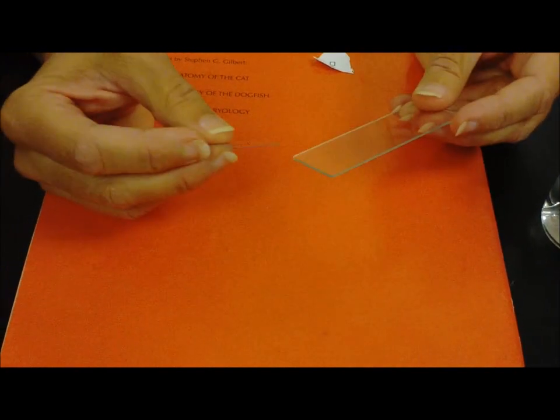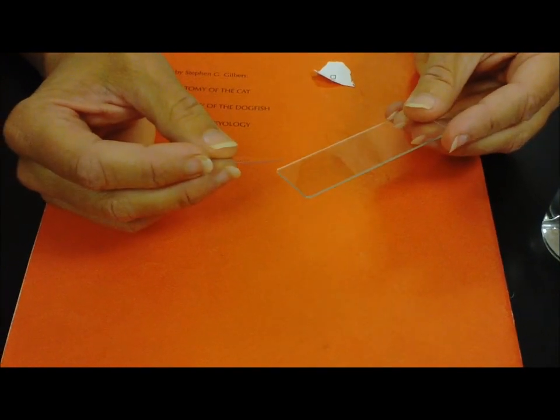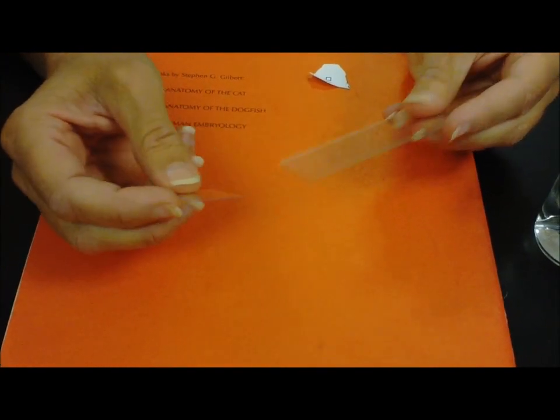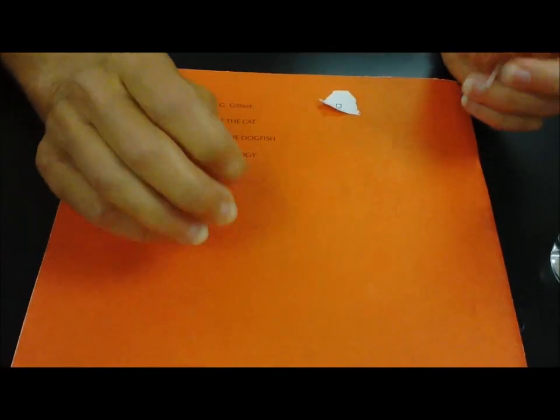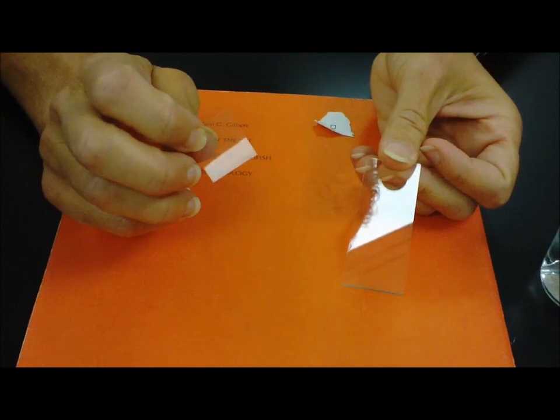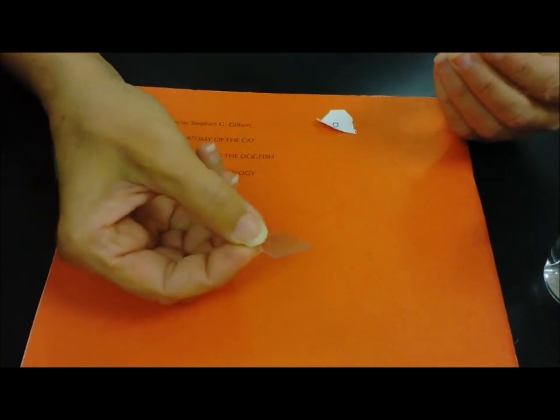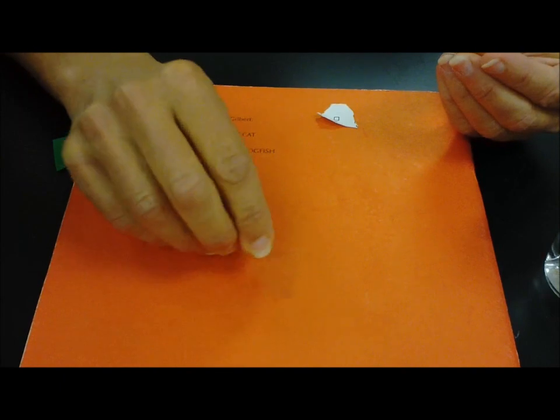Okay, sometimes you're going to make your own slides and we call those wet mount slides because you're using water. This is the slide and this is a plastic cover slip. The slides will clean and use over and over again. The cover slip at the end of the day you may throw away.